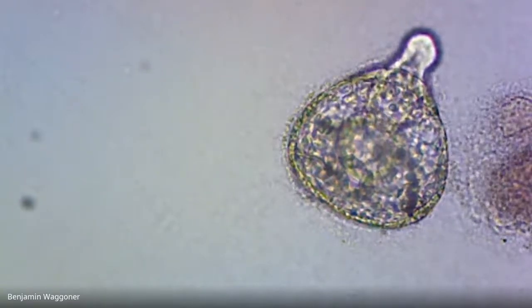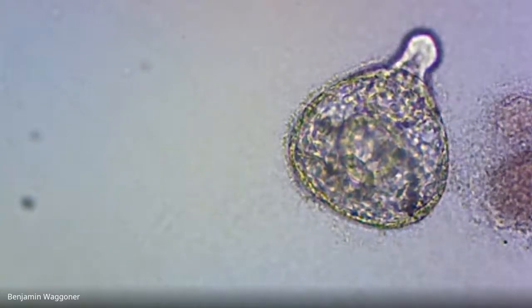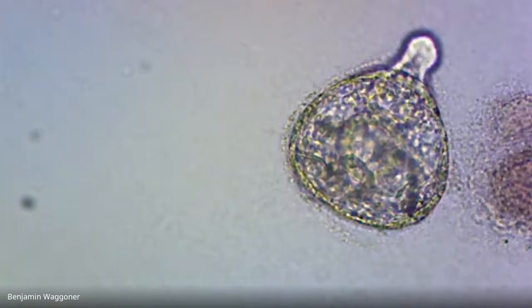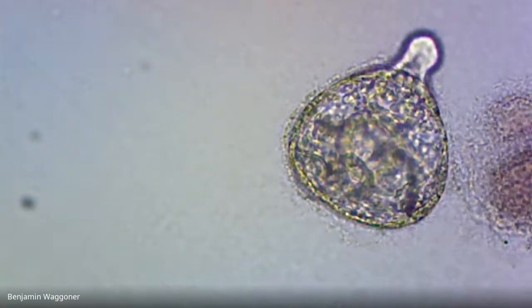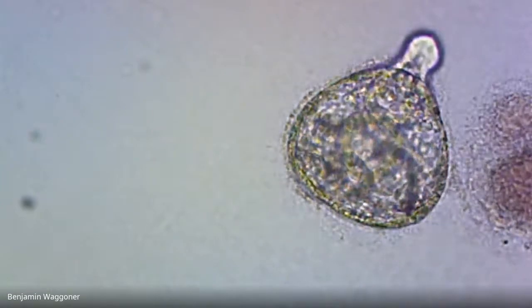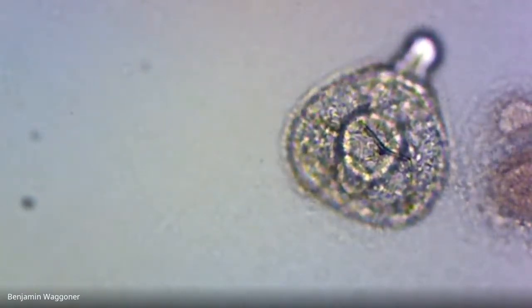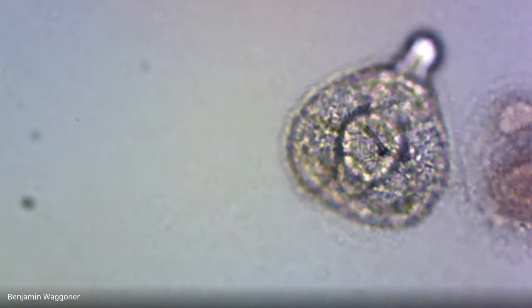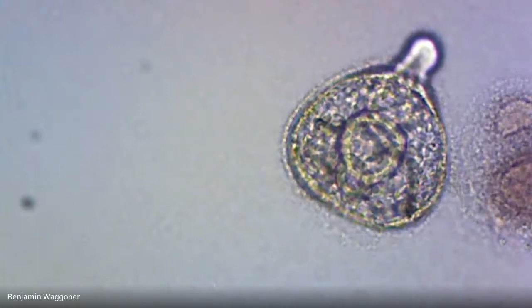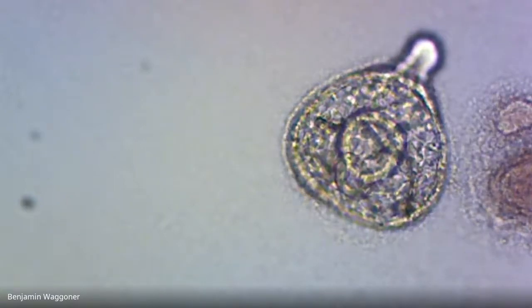There we go. Okay. So it's developed at this point enough to have functioning muscle cells or contractile cells anyway. And I can see a complete gut. You've got that central stomach right there that's in focus now, but there's little sections of it in front and behind. Like right now, I can see the 5 o'clock. There's a second little circle right there, and there's another one at about the 11 o'clock. And I think those are the anus and the mouth, respectively. So we have got a complete gut now. This thing has completed gastrulation.